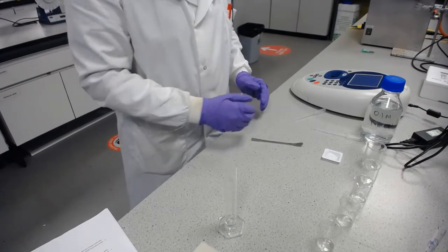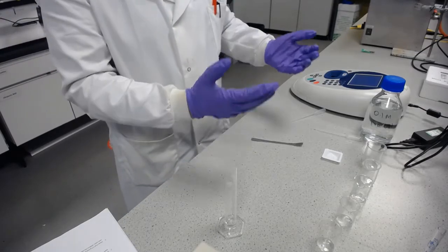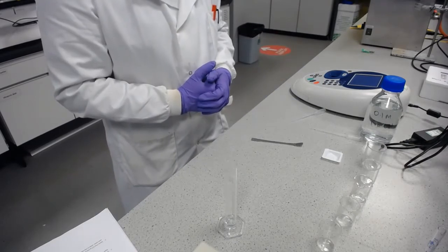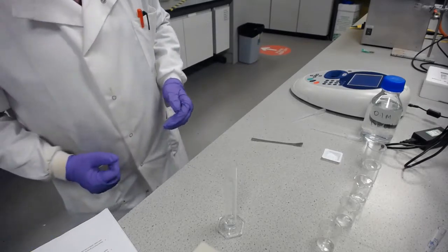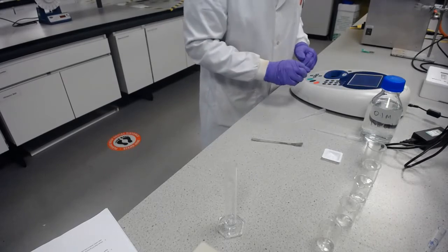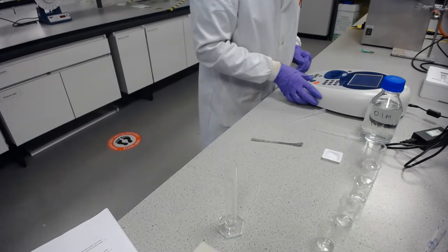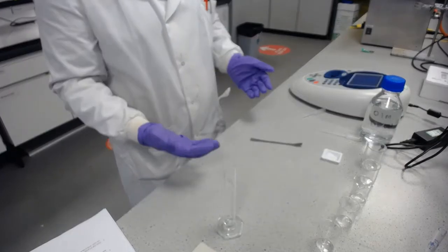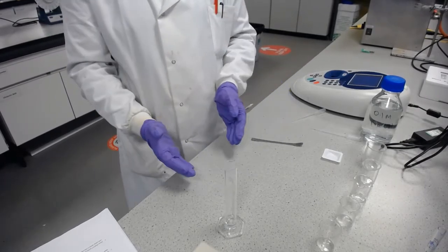So to do that, we're going to need various concentrations of trimethoprim in sodium hydroxide, and then we need to take their readings. And the wavelength we're going to do this at is 287 nanometers. So I'll just set up the UV vis to do a single wavelength, 287. And rather than making up lots of different concentrations, we're going to make up the one largest concentration and then do serial dilutions.